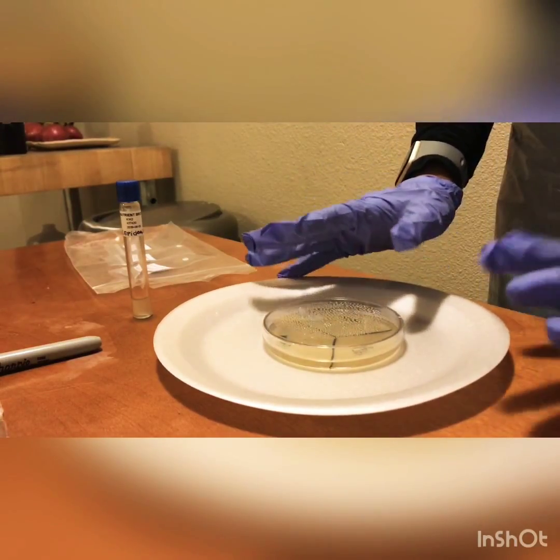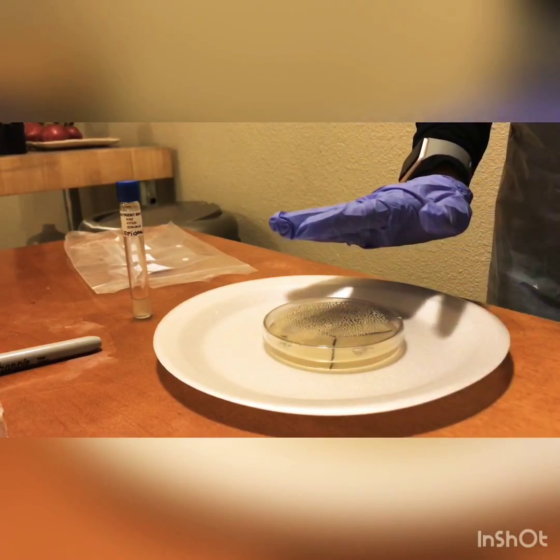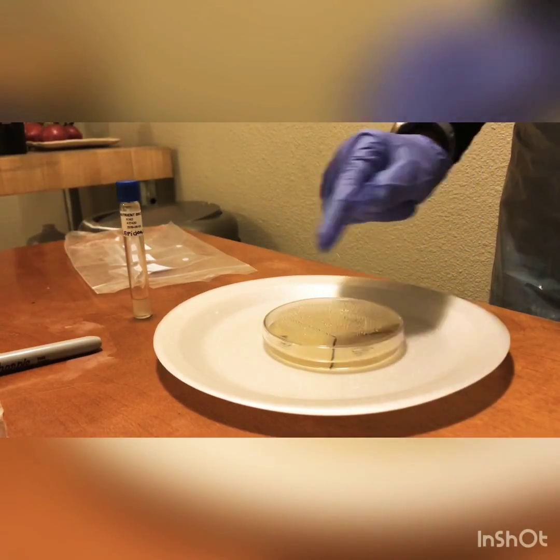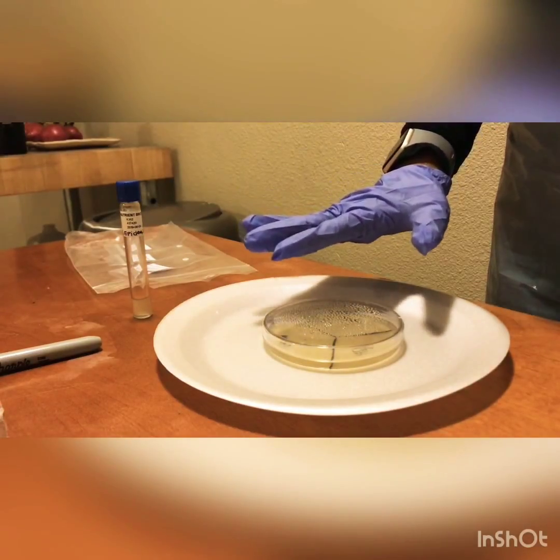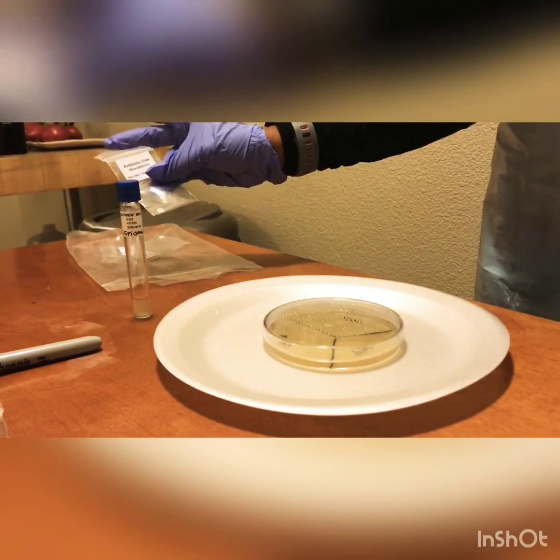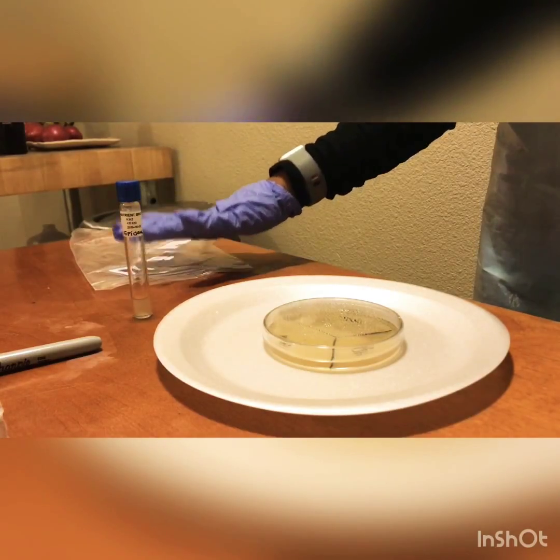After we have put the active culture in there and labeled it, it's asking us to leave it undisturbed for the next hour or two until the broth is absorbed into the agar. Once we come back in an hour or so, we'll be able to move forward and add our antibiotic discs, and we have 3 available that were provided for this experiment.